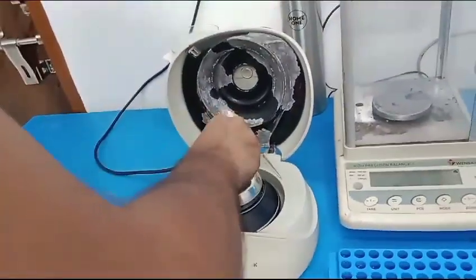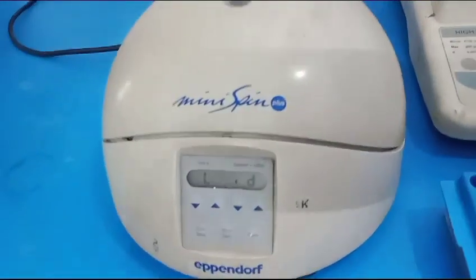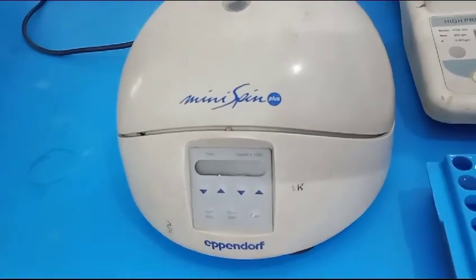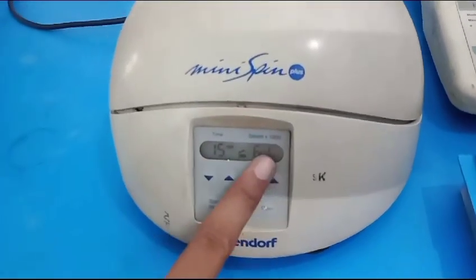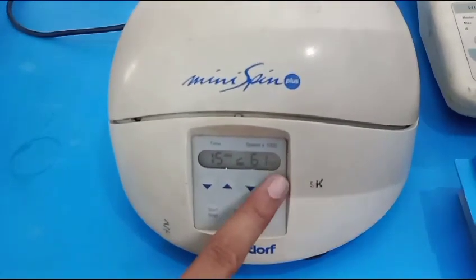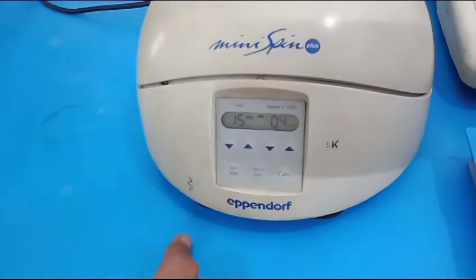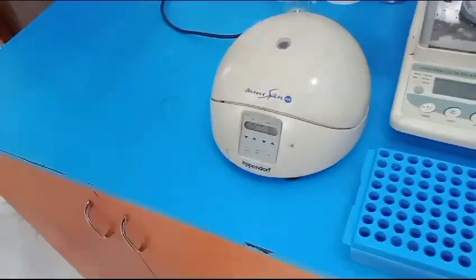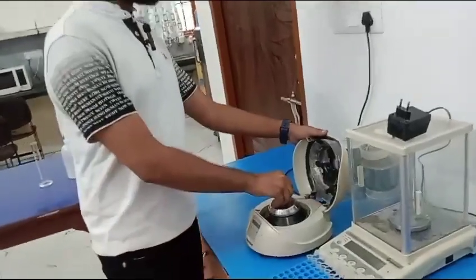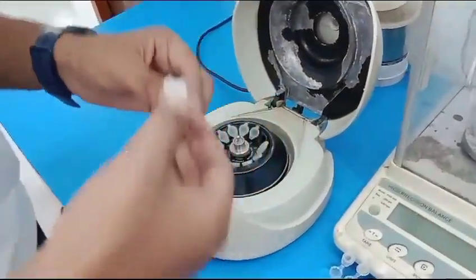Here I am covering it. Now you can see the time is set to 15 minutes and the speed is 6000 rpm. I am going to start it now. You will see the result after 15 minutes of centrifugation. Now I am taking it out from the centrifuge.